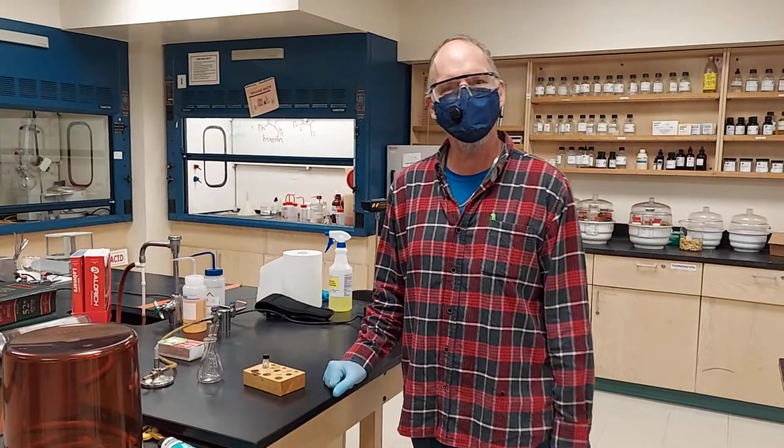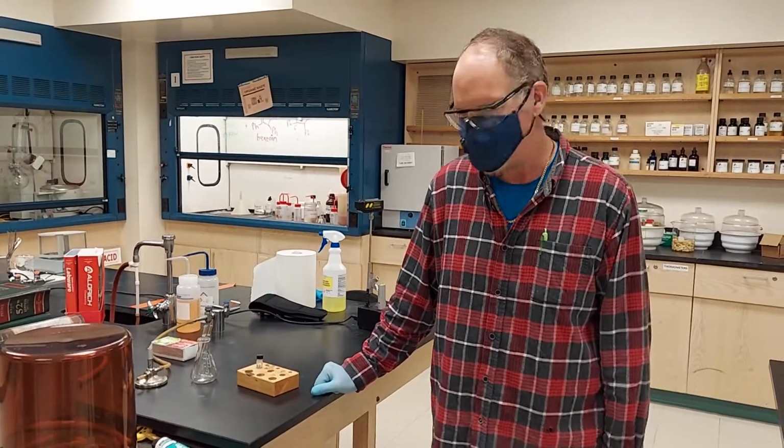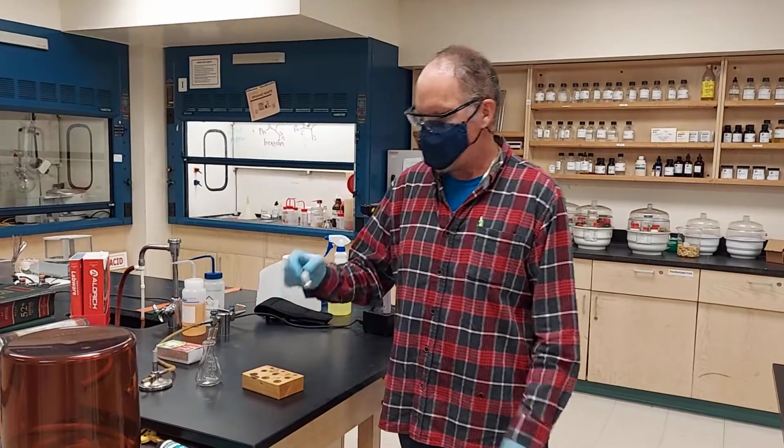Hello everybody, we're going to do an evacuated melting point today. We're going to use caffeine.